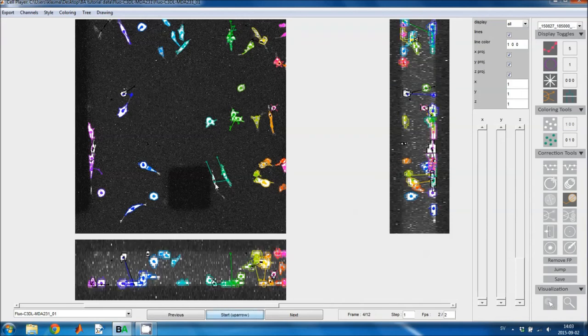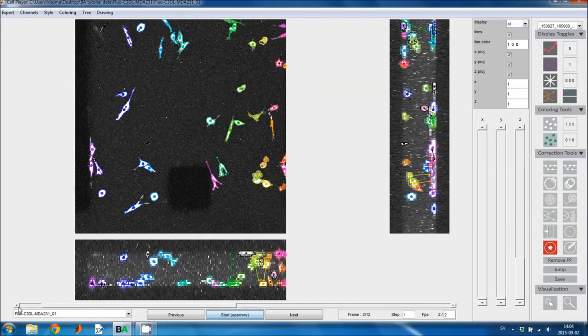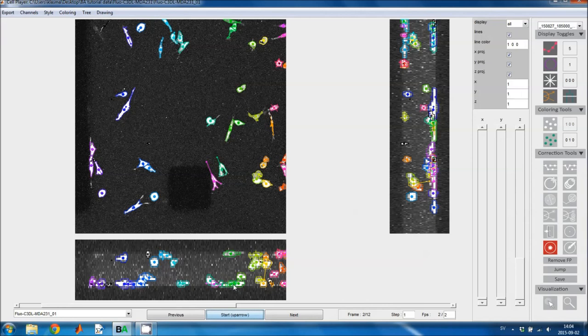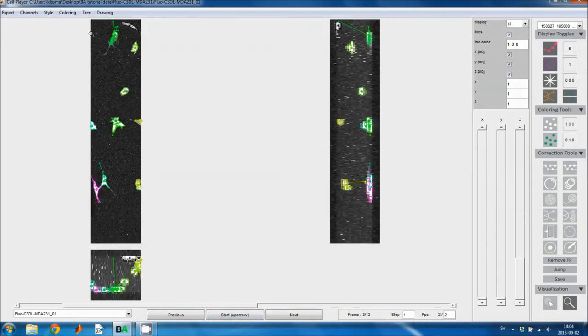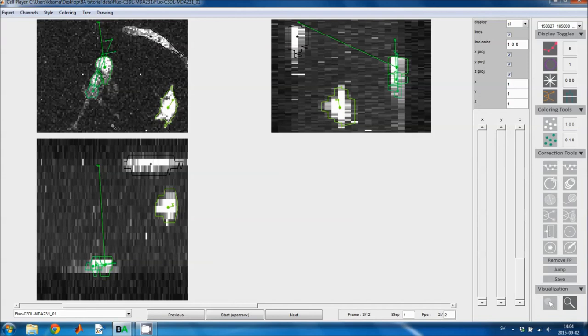And here is another mistake. Now the cell shouldn't share outline with that cell anymore. It should be linked to this, so I'll relink it and delete the end of the track. And here we can see something where a cell moved from here down to there. So I'll zoom in all of the views to see what actually happened. And this track here should have been linked to there.